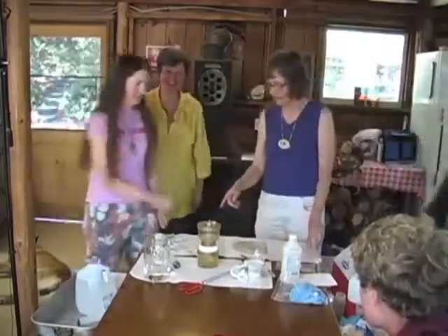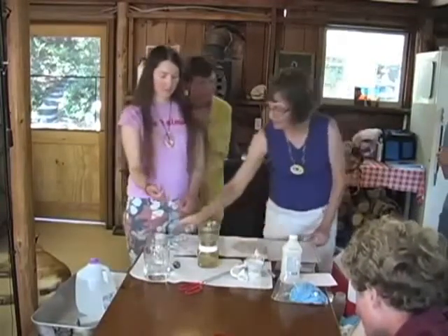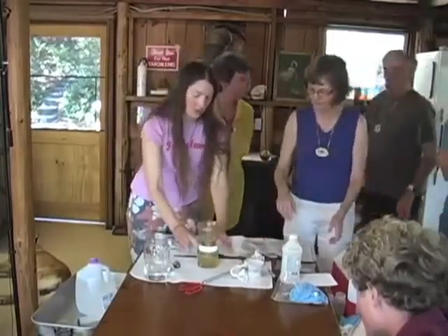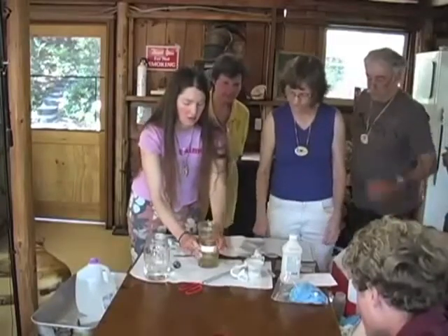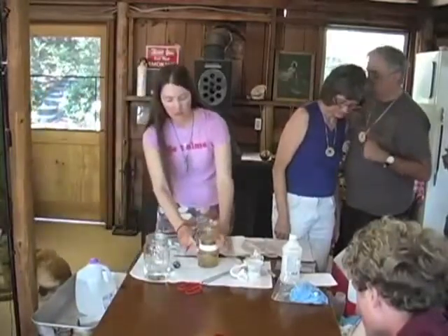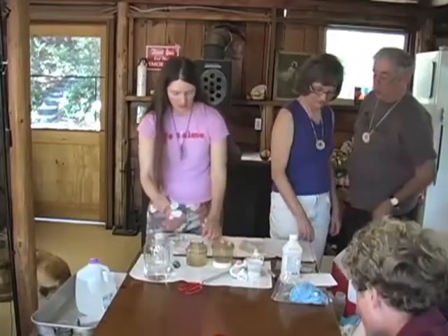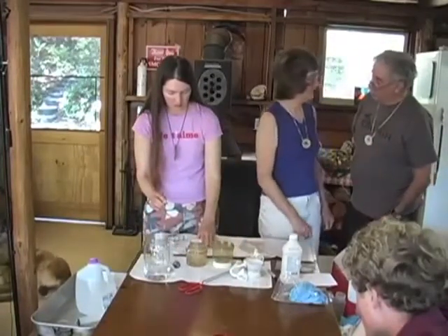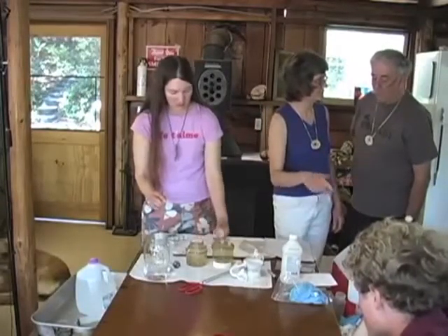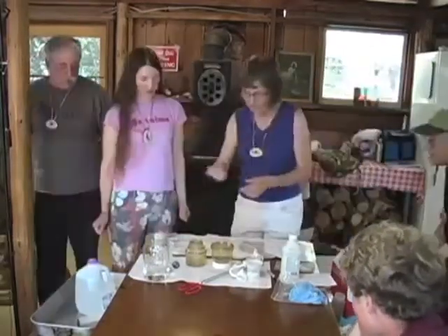Okay, we're ready to do the next part, which is re-sanitize. And now we're going to transfer that to here. You take the lid off. Yeah, it comes out. Then I'll go vacuum this way. Last one. Hook your hose up. Contaminated. No, for the next one, if you're going to do one more test. So we find somebody else, okay, so this is already made. I think okay, so I'll take this away. And it's ready. All right.